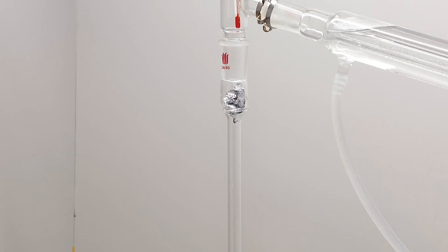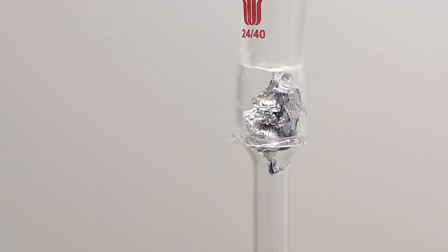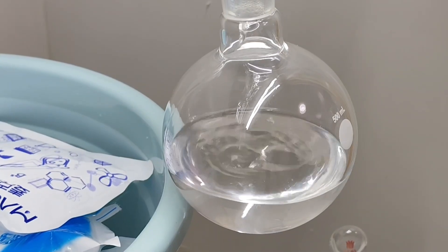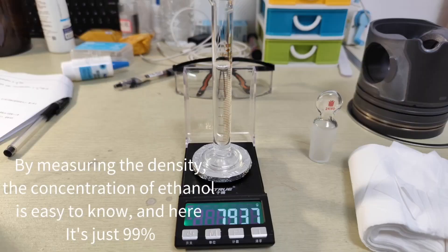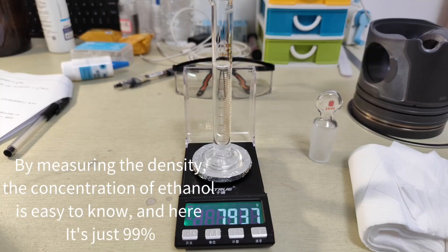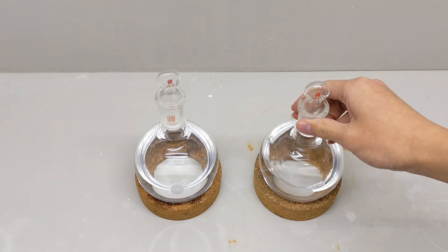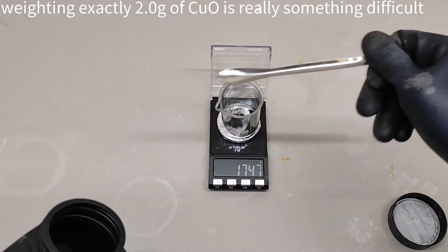Some people may tell you this is entirely anhydrous ethanol. This kind of ethanol is anhydrous enough for most experiments, but there is actually still about 0.5% water in it, because calcium oxide cannot react with water completely. If you want absolute ethanol — meaning 100% without even a drop of water — it is necessary to react it further with magnesium metal or molecular sieves.